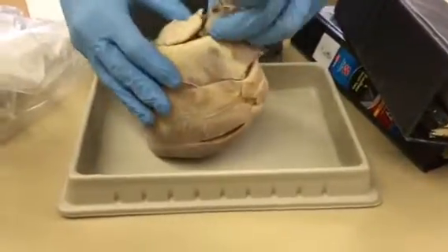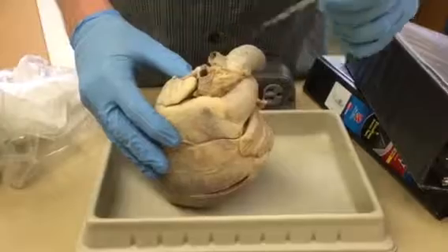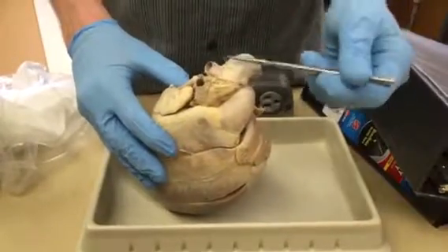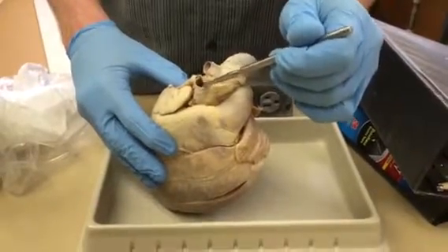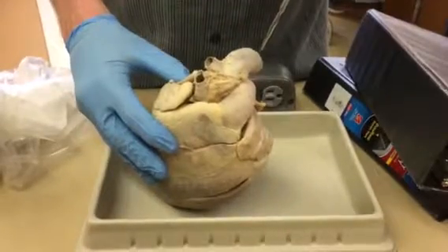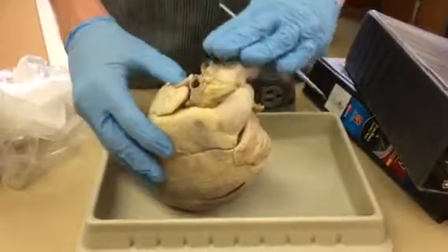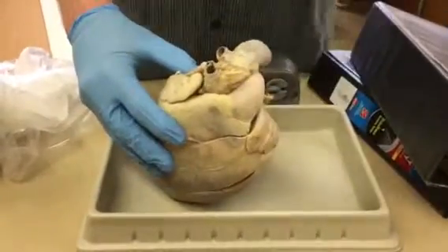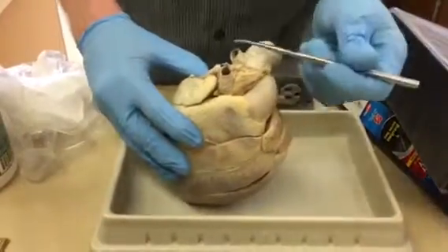Then we have the aorta, which is this guy. And on yours, you do have two of the three vessels. So some of them have this one cut as well. So when we go look at these, we have the brachiocephalic trunk or artery, and then we have the left common carotid, and then over here would be the left subclavian. But because these two, the one that's not on yours and this one, are not there on all of them, I can't pin those, so I can only pin brachiocephalic. Okay. And again, on here, they don't even show them on that model, but if they were on the model, they'd go that way.